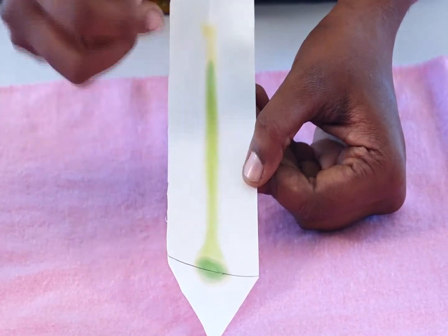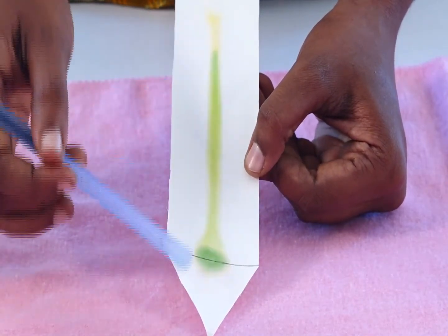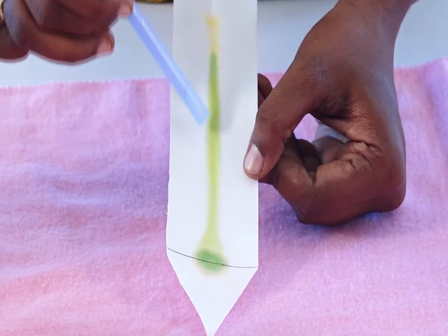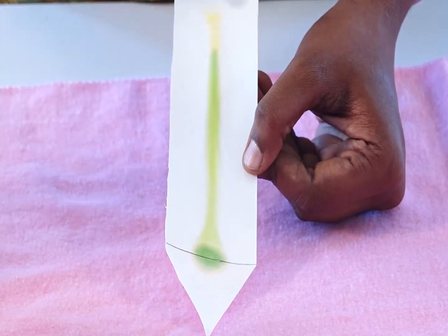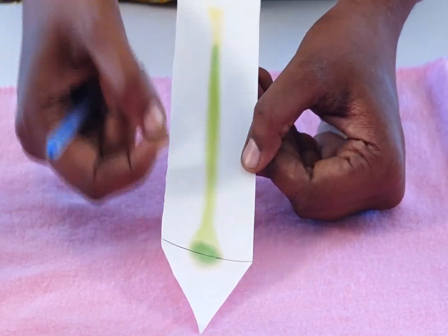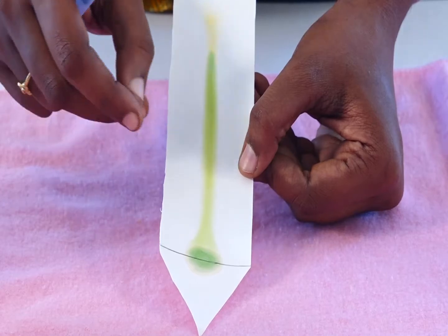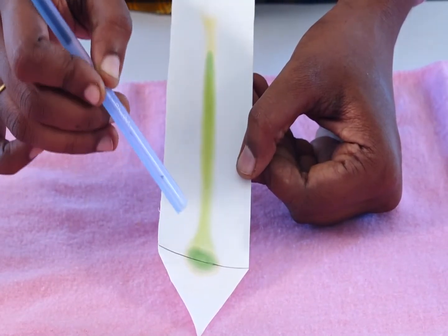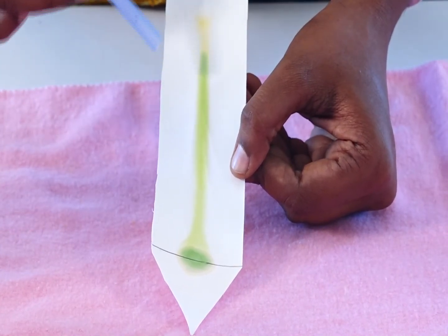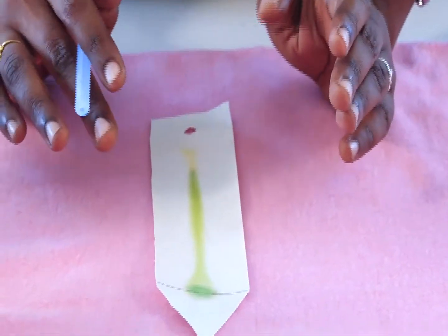This type of separation is called monodimensional chromatography, because the pigments move in a single direction — upward, opposite to gravity. We can conclude from this experiment that pigment separation occurs on the basis of molecular weight and solubility in the solvent. This completes the paper chromatography method.